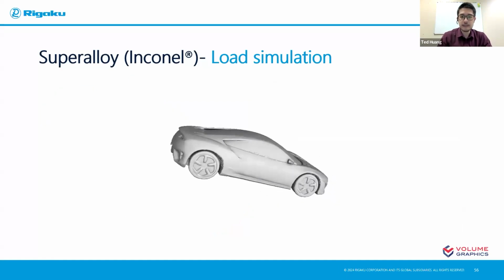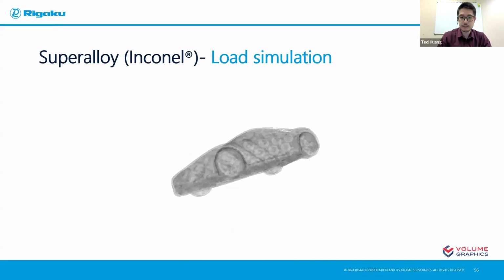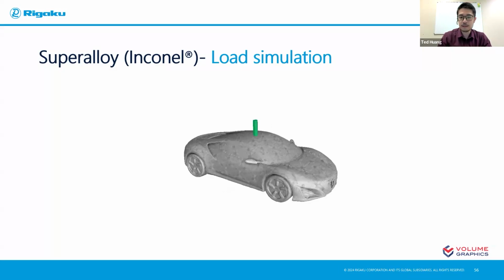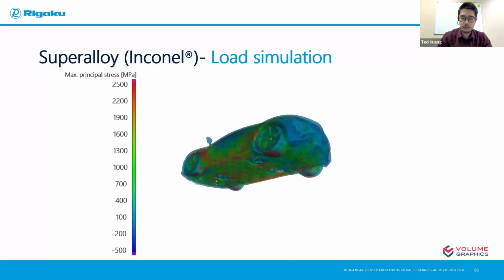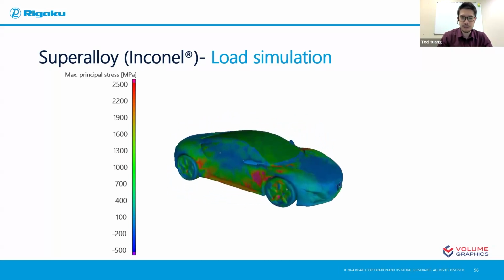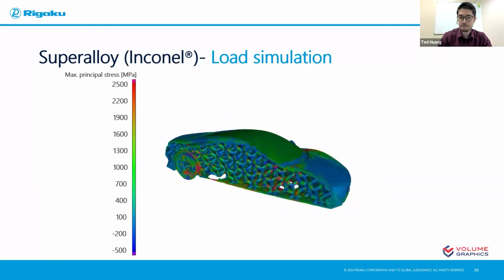So here is, again, a 3D rendering of the surface that I rendered using the scan results, and then putting this surface render into the finite element simulation to simulate that force acting on the top of the car, like this green arrow, and then showcasing the maximum principal stress distribution in 3D, with some nice rotation and some transparency to give you a view of different angles. And if it doesn't tell you a lot, because 3D can be a bit too much sometimes, you're always welcome to slice it open in 2D and get a look at the area you're interested in.